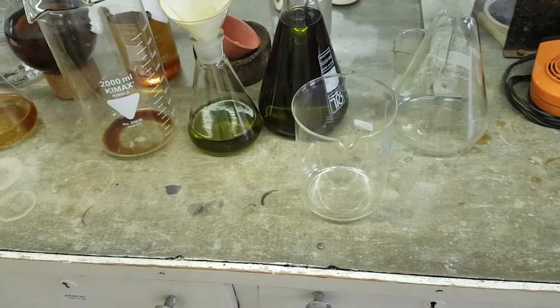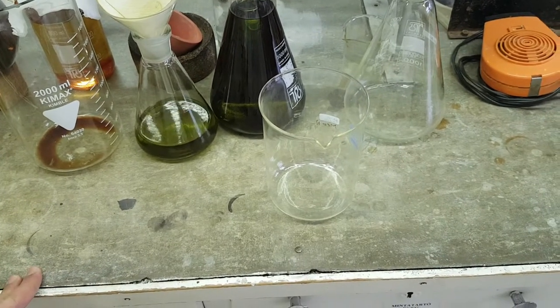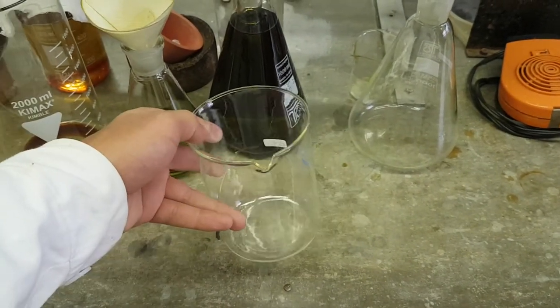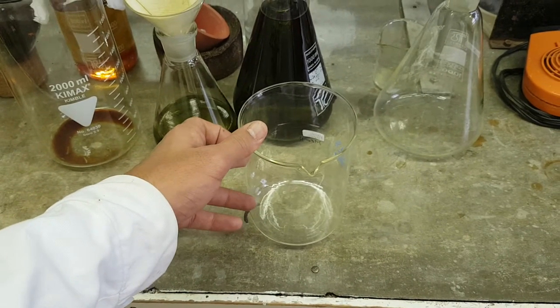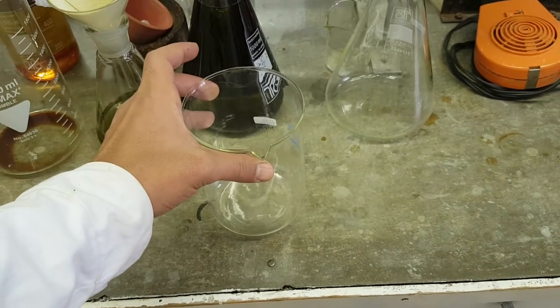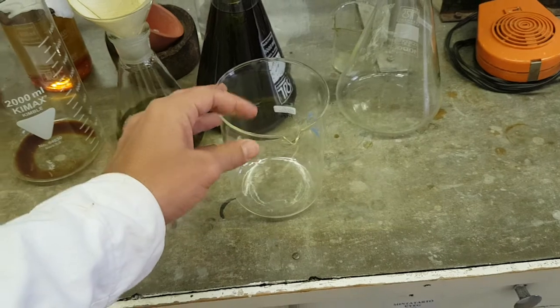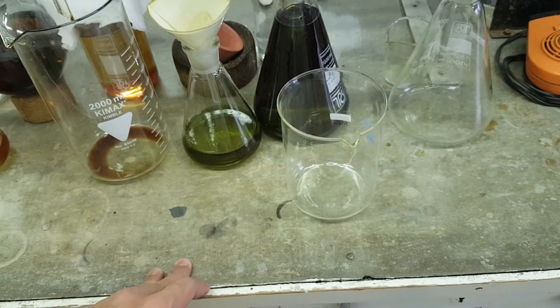In order to make fractionation or isolation of a specific molecule, firstly you need to take your plant and put it inside a beaker. You add methanol, a polar solvent, and you can recover all the molecules — both polar and apolar. Then you put your beaker inside the ultrasound to make some sonication. It is better to do it without temperature, as temperature might modify the structure of your molecules.